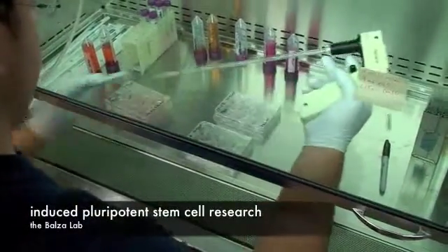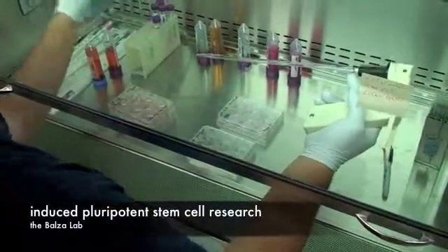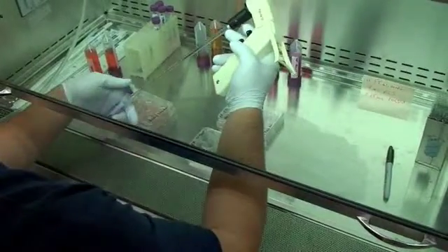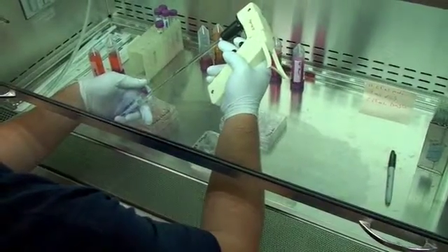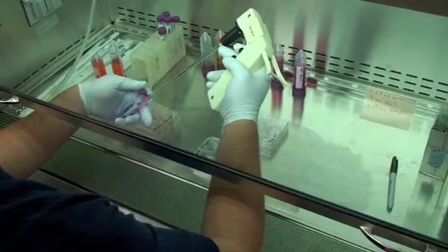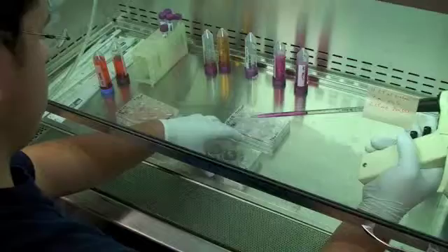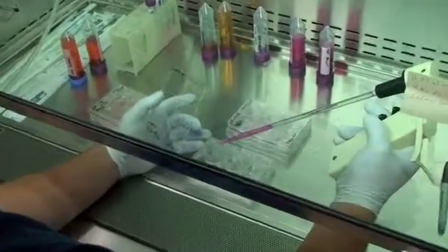Cardiovascular research around the world is limited by a lack of suitable contractile cardiac myocyte cells that can be used to represent the heart in various stages of development, disease, and repair. Work in several laboratories has recently shown that contractile heart muscle cells can be derived from embryonic stem cell lines.